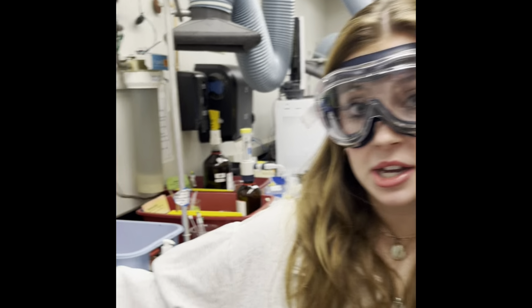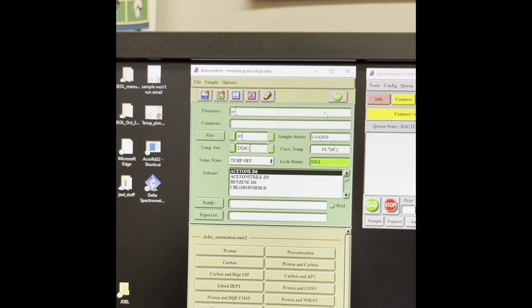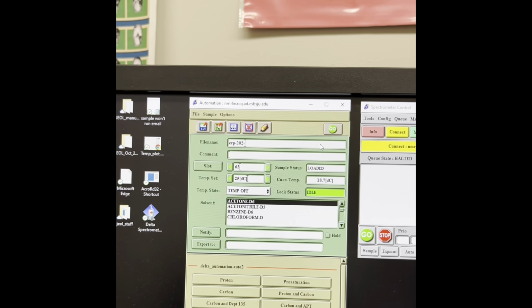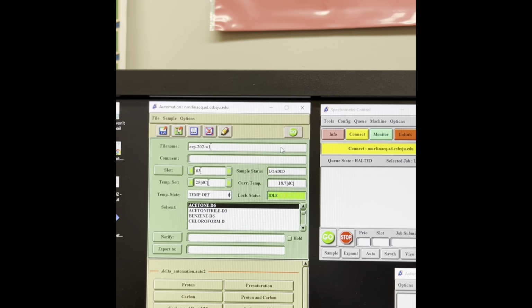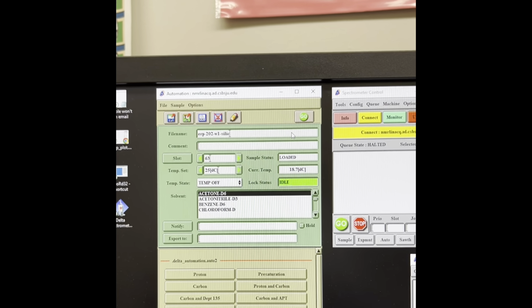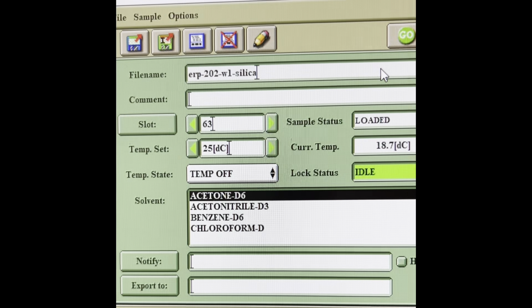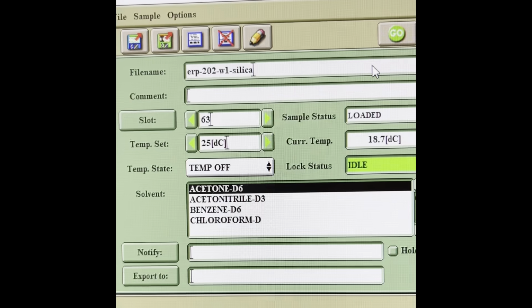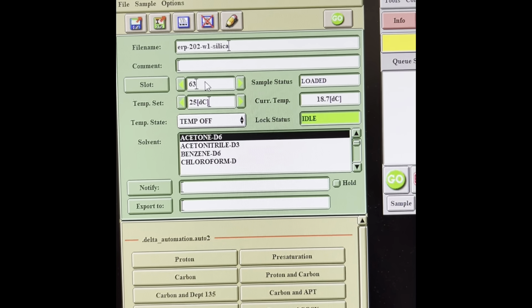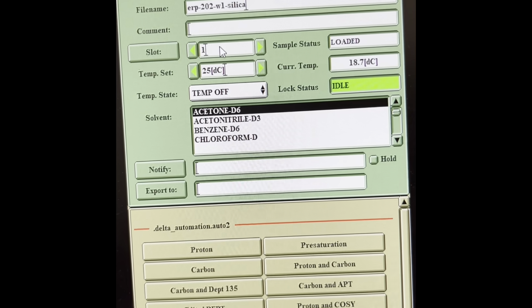Now that you have this page up on the computer, you can go ahead and start filling out the information for your sample so the data can be sent back to you once your data has been run. You should label your sample in the file name section using your initials, the number of your lab section, the date and time your lab is, and an abbreviation for what lab project this sample is for. After you've labeled your sample in the file name area, you should go to the slot area and make sure you put the correct number slot your sample is in on the rack.